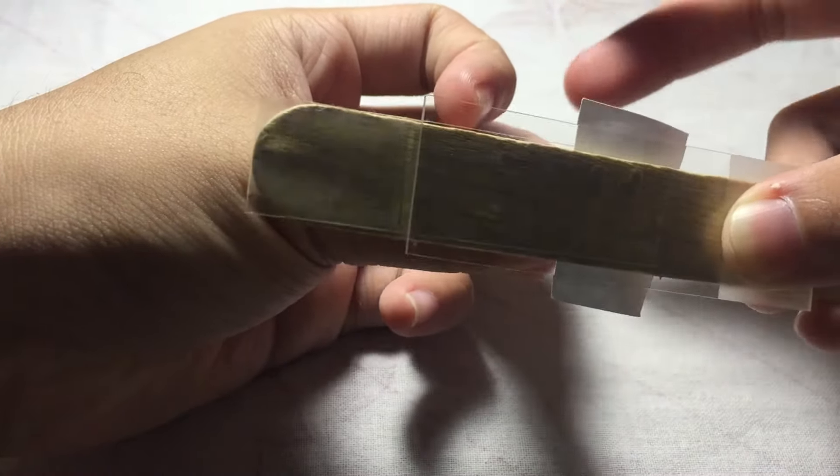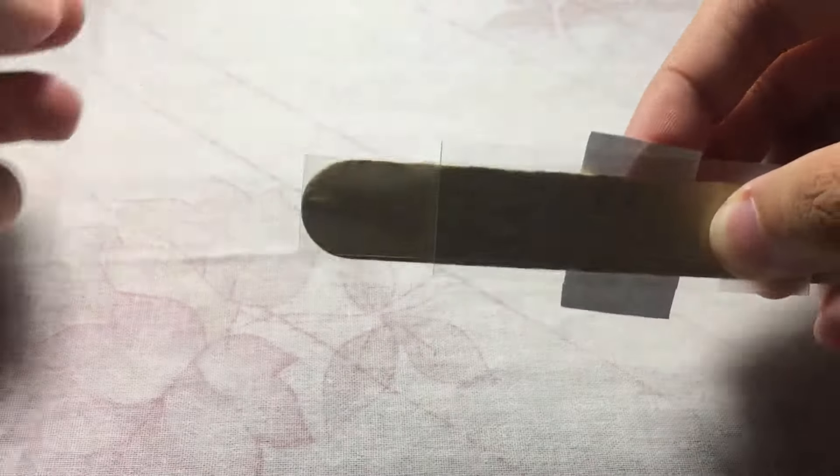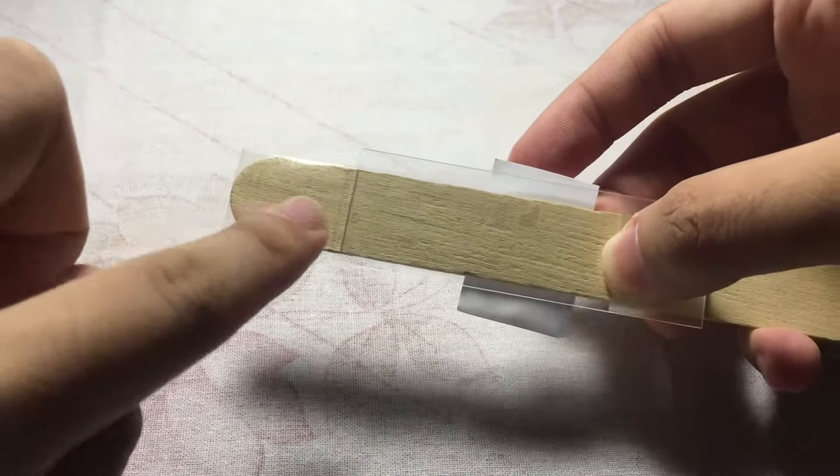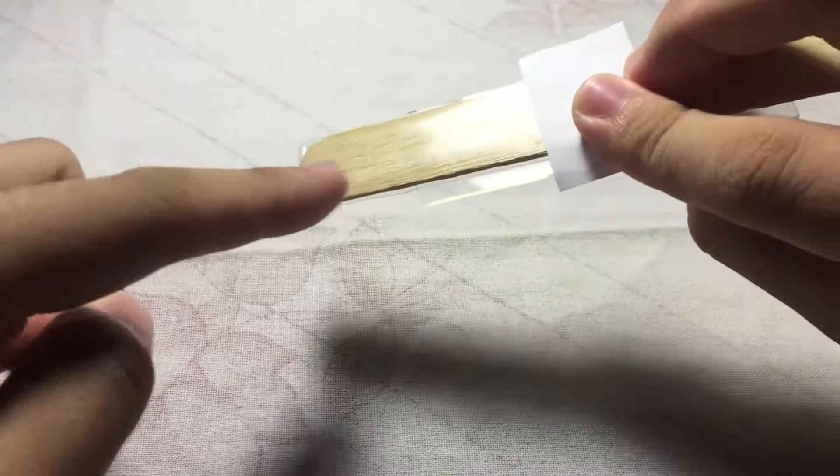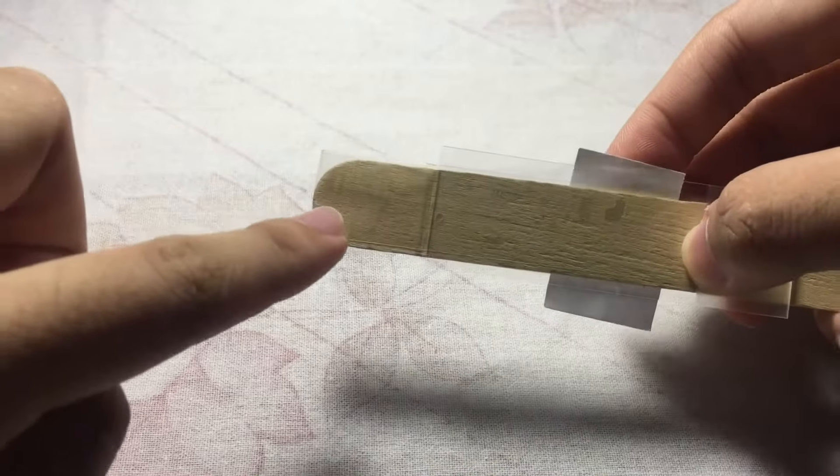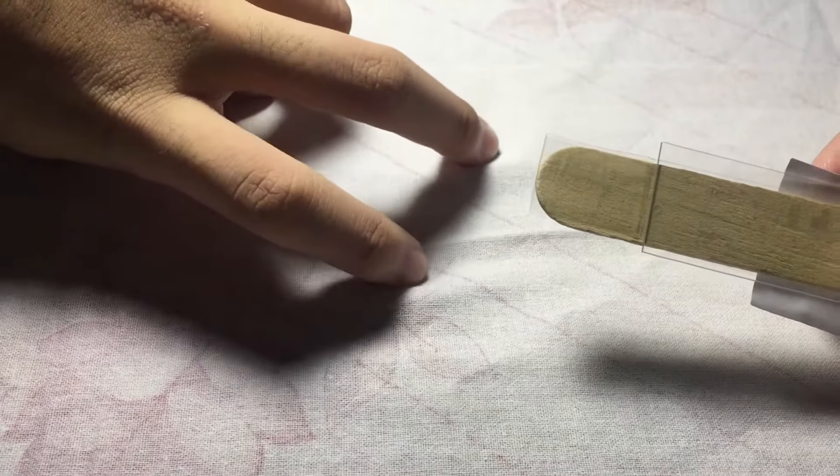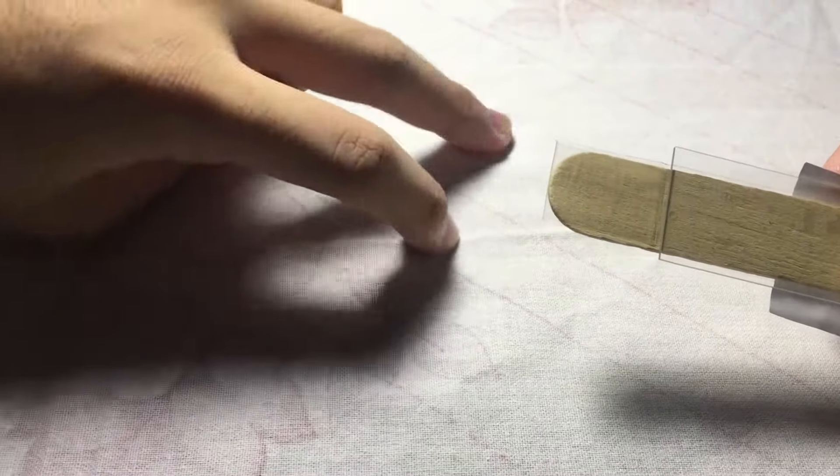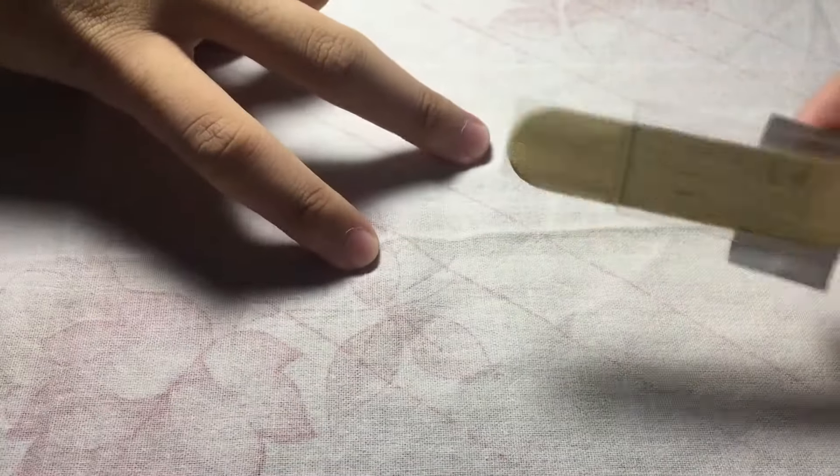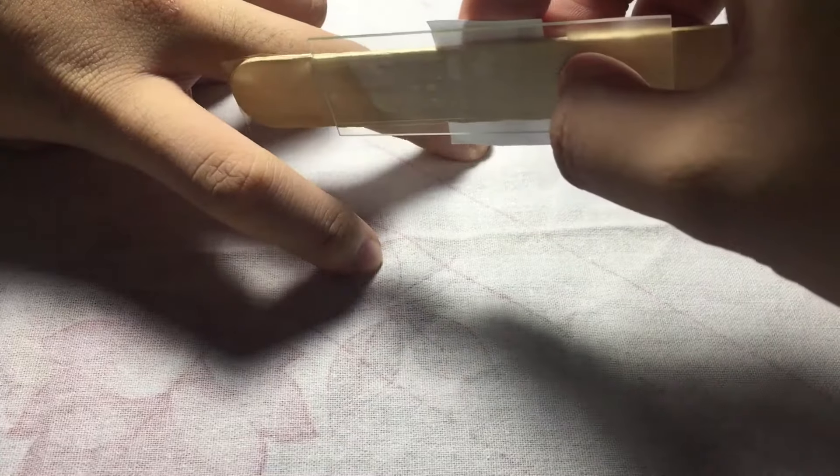Using your other hand, you get the flap. Now this will serve as the sticky area of your scotch tape swab where your eggs will be collected. Let's say you have your patient - this is the perianal region of your patient.